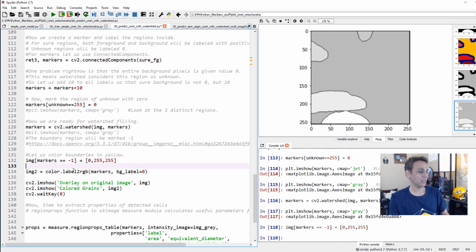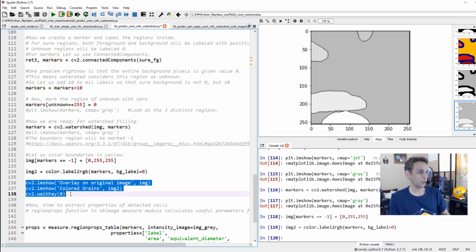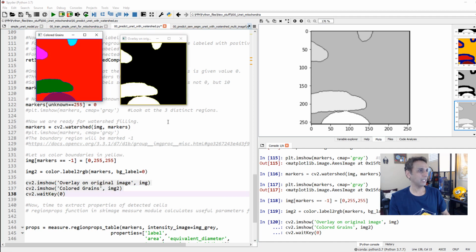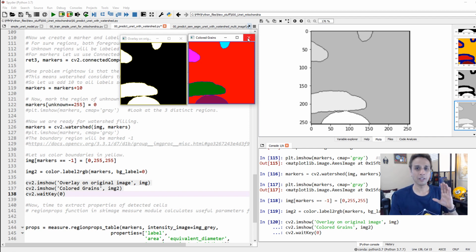So my markers are in yellow, and now let's convert the labels to RGB and markers. Yeah, you'll see the output. This is pretty cool. Once we are done with this, let's plot it in OpenCV. And there you go. So what it did is labels to RGB. As you can see, these are all my colored grains. Okay, I hope things are clear now. You see, these two used to be one entity. Now they are separated into objects 1, 2, 3, and 4. So we have 4 objects in this image.